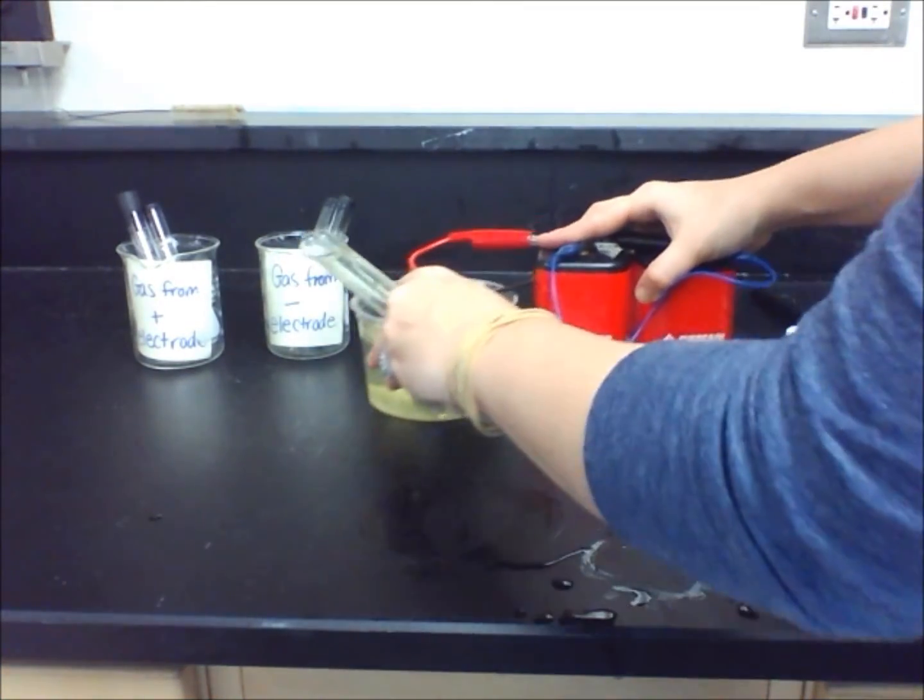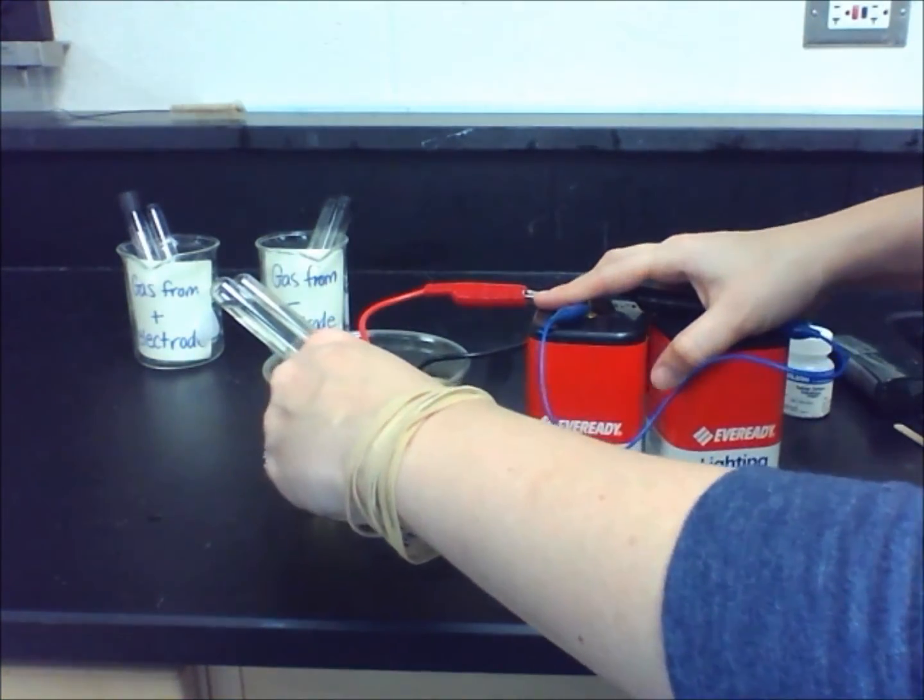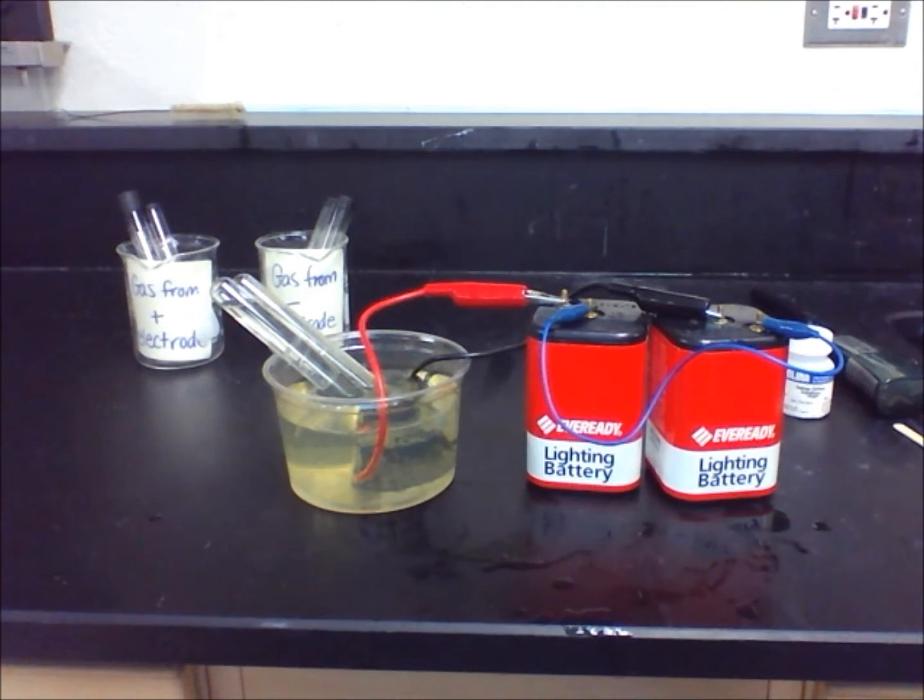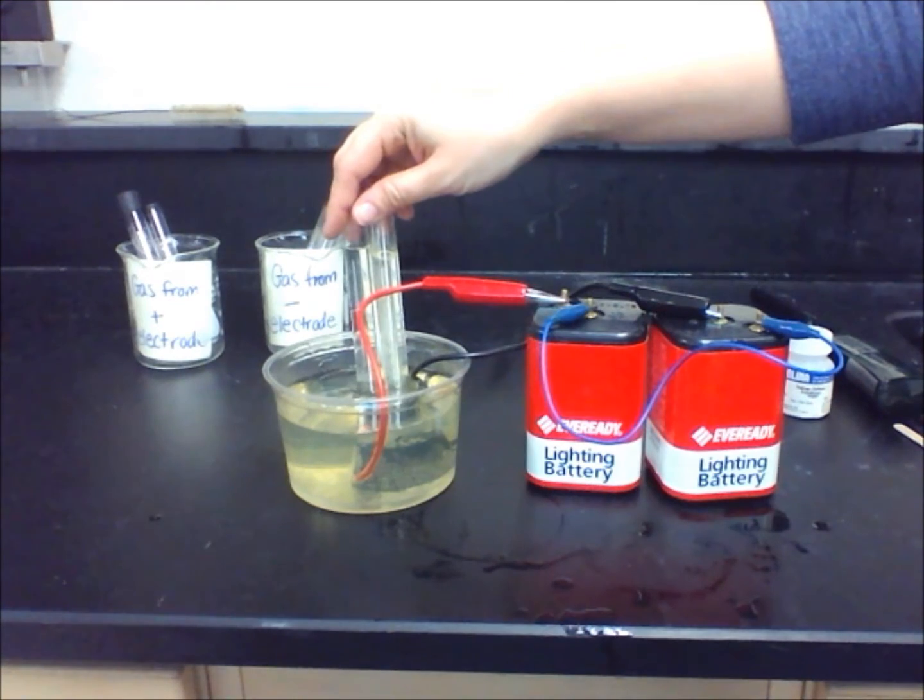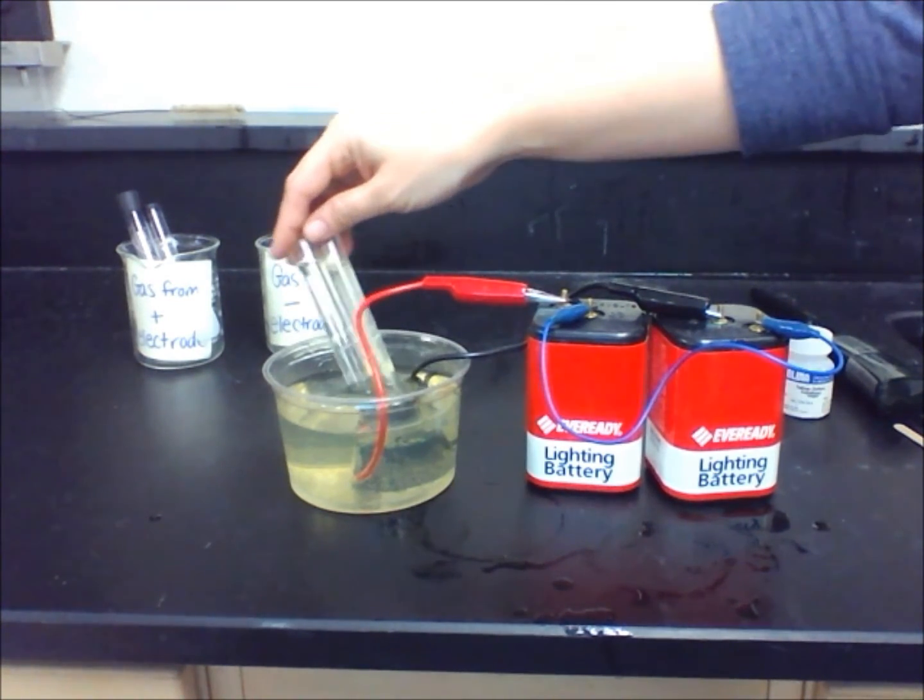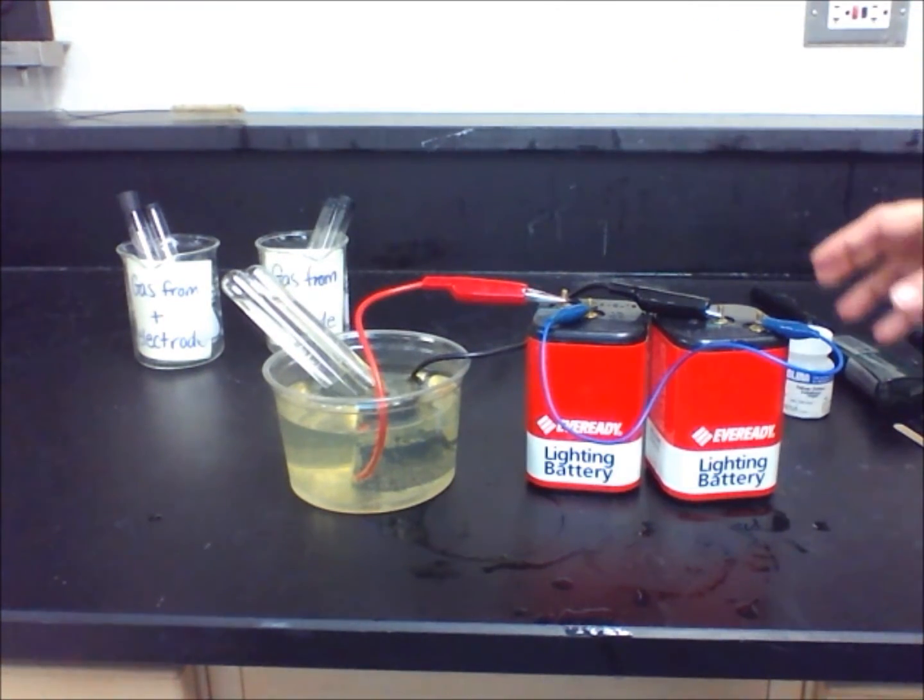You will notice as the bubbles rise, the water seems to be leaving the test tubes. This is just like our previous lessons when we tested density. Because the gas is less dense than the liquid, it is filling up the test tube and pushing the more dense substance to the bottom and out of the test tube.